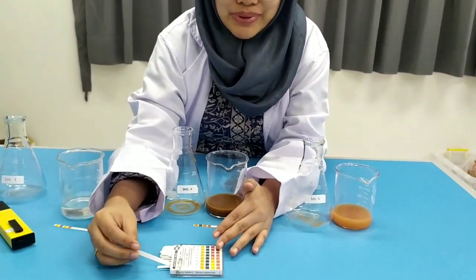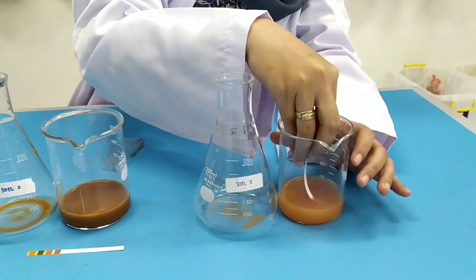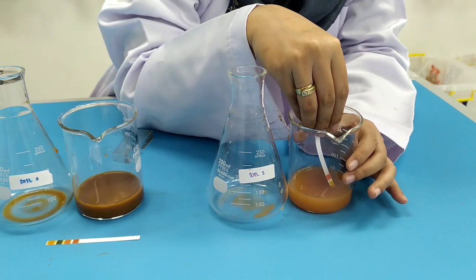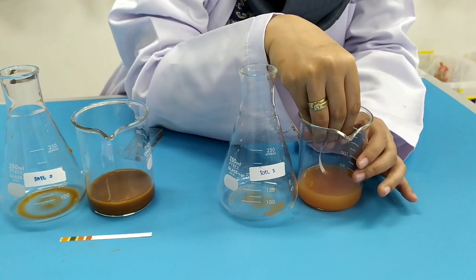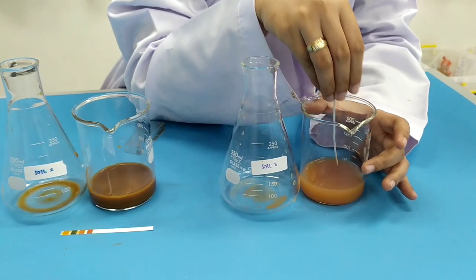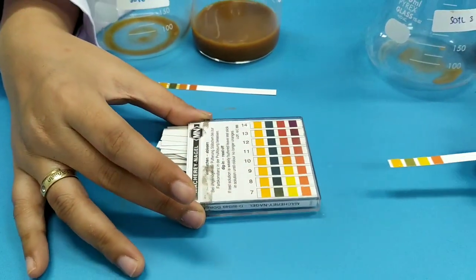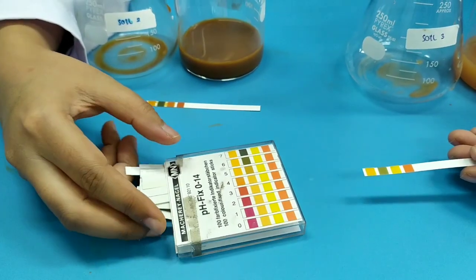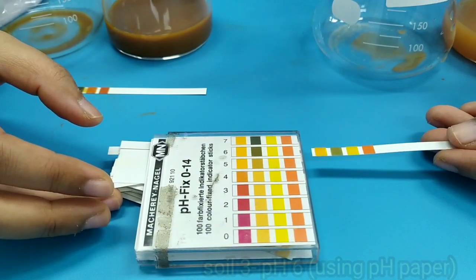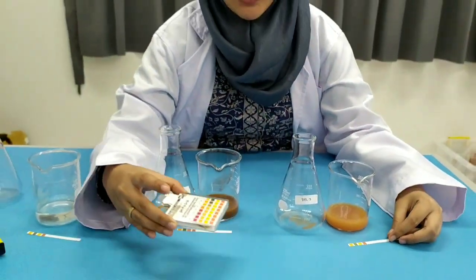Now we will take the last pH paper and test it on soil three. Let's dip it for a moment and see the difference in color. This is the color of soil three — it's not in that area. I think it's 6 again. So we have two soils that are pH 6. We are now finished with the pH paper.